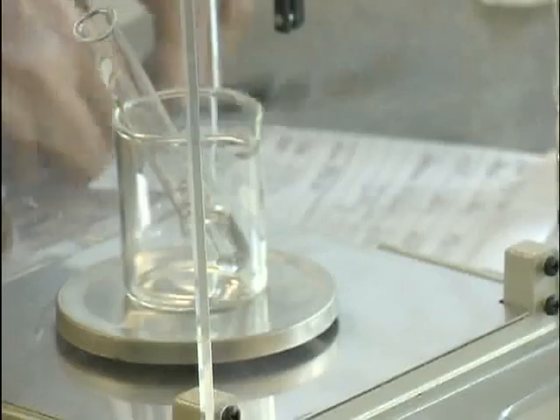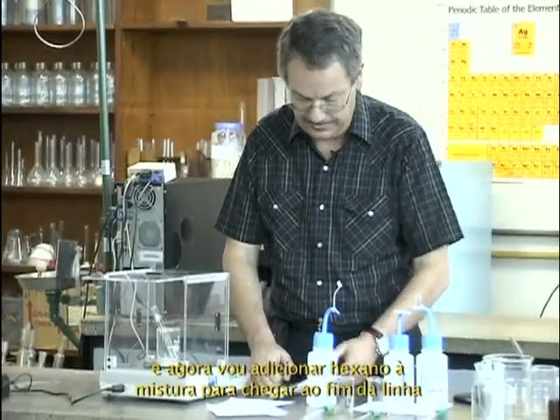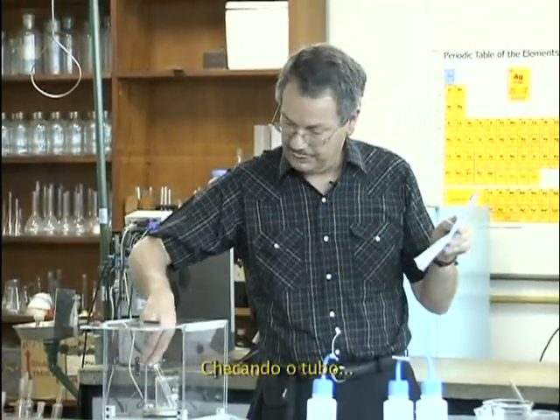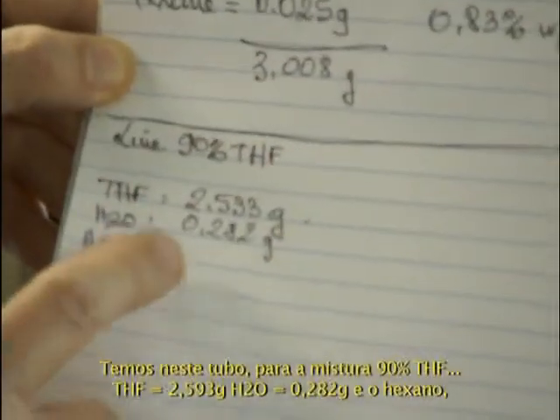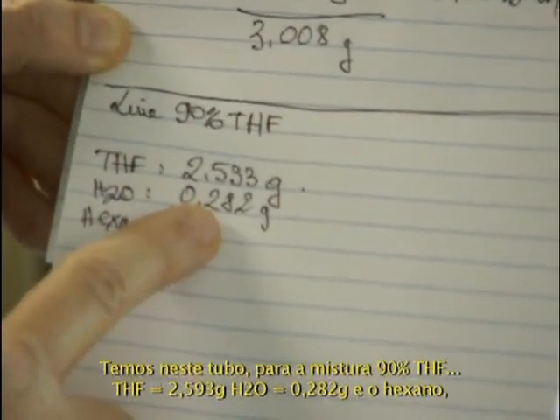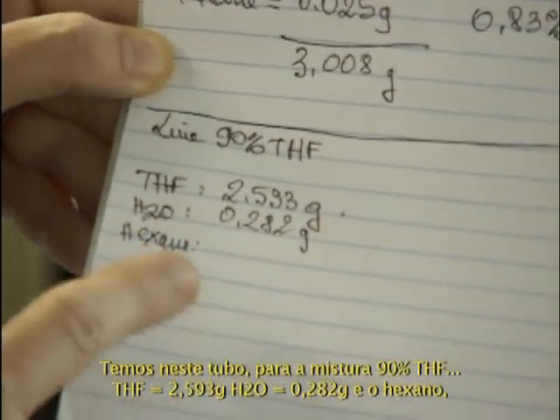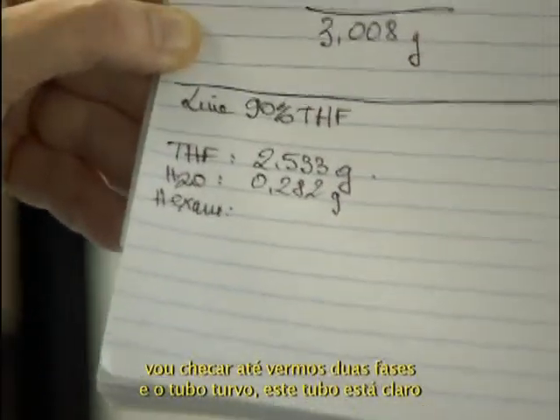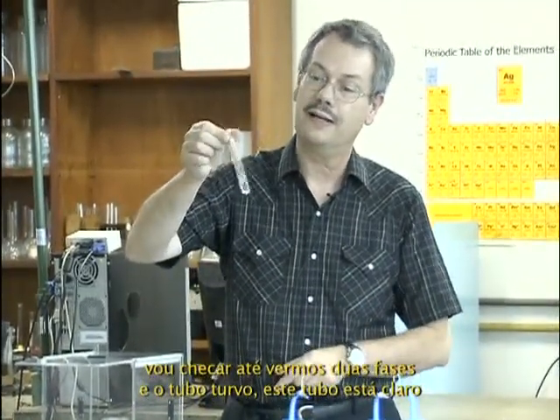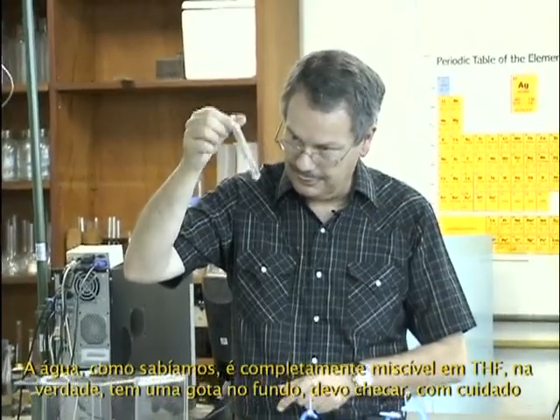0.282. And now I am adding hexane in this mixture to get the end of the line. Checking the tube. Okay. We have in this tube for the line 90% THF: THF 2.593 gram, water 0.282 gram, and hexane I will add until seeing two phases or a cloudy tube. This tube is clear. So water, we knew it, is completely miscible in THF.